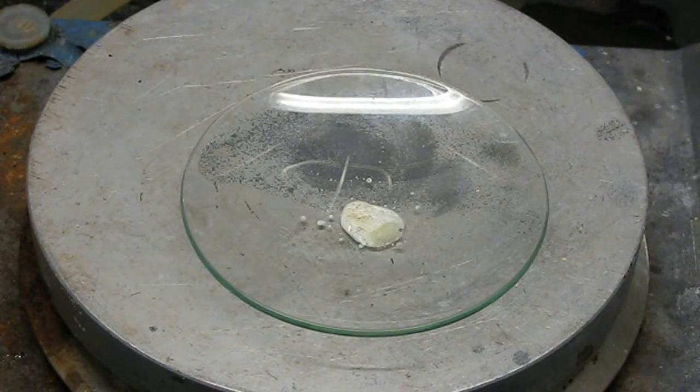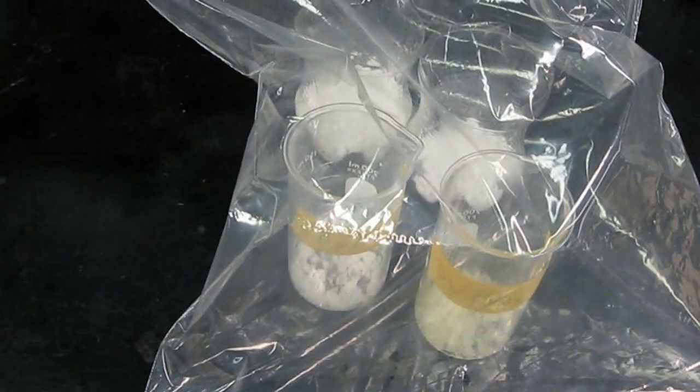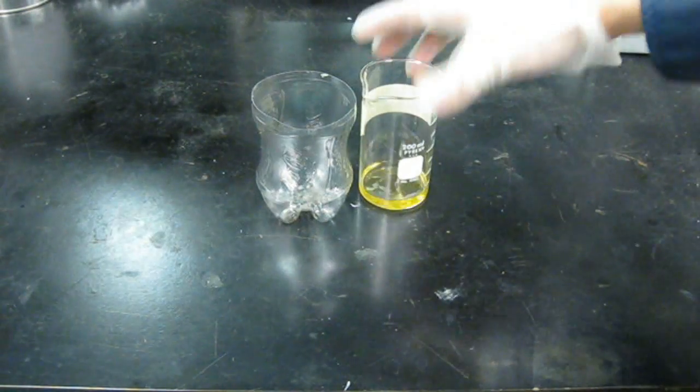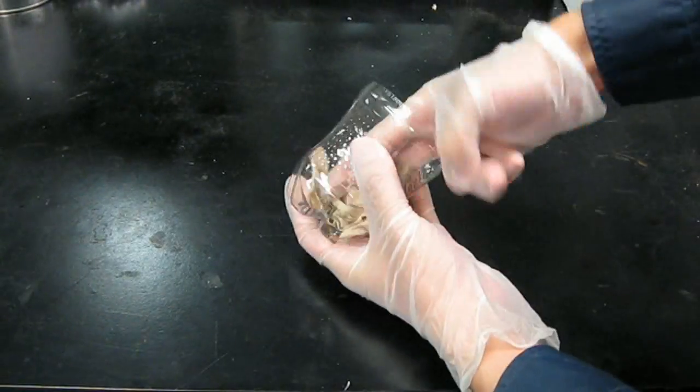For these extremely delicate chemicals you'll need a device called a desiccator. In this video we'll make a desiccator bag. The process is brutally simple. First get a plastic soft drink container and cut it down to approximately the same height as the chemical containers you intend to use. Make sure it's completely dry.